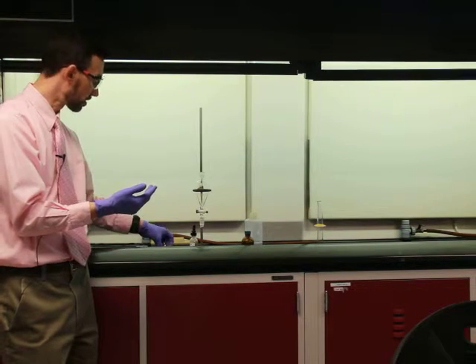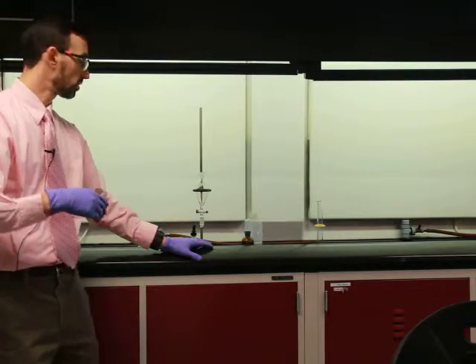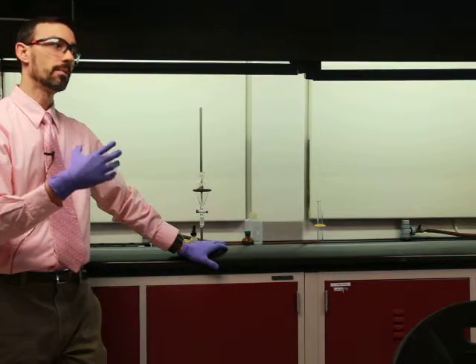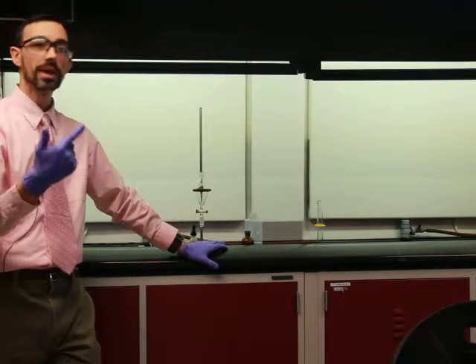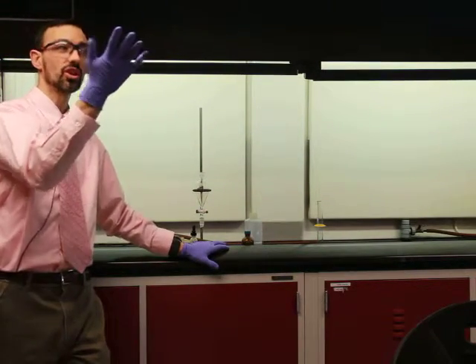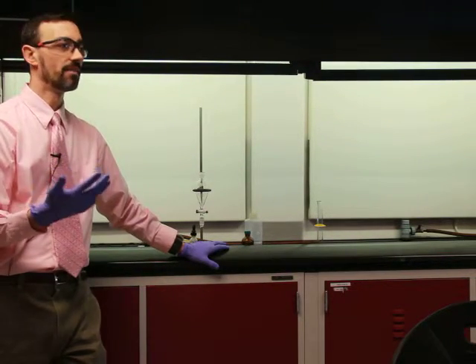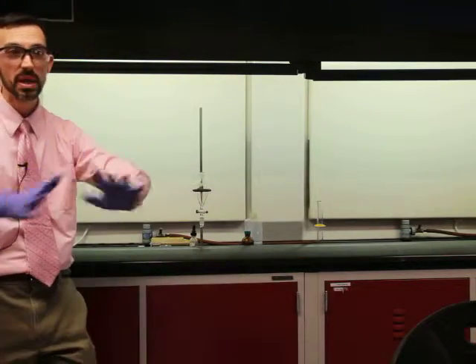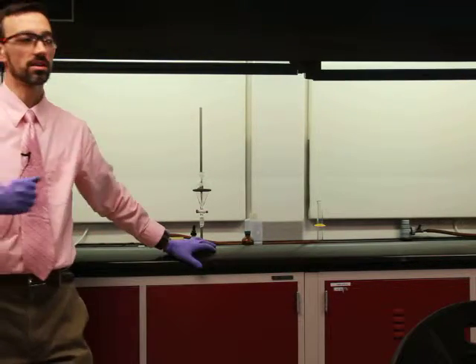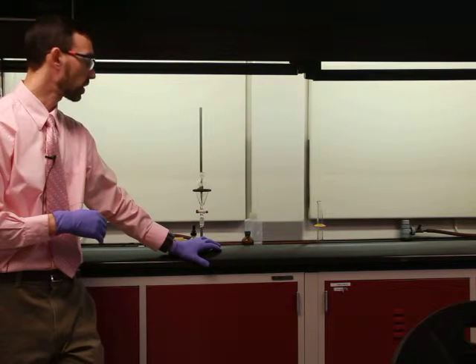If we were in a greater hurry, or we had another solvent that didn't evaporate quite as easily, we would use a technique called either distillation or rotary evaporation, where we basically agitate the sample, heat it, and expose it to a vacuum. So we're lowering the pressure, which lets the solvent boil more easily. We're heating it, so we're helping it boil off, right? And we're spreading it out, making it a big thin puddle rather than a deep setup. Those are all the ways to speed up the evaporation or vaporizing process.